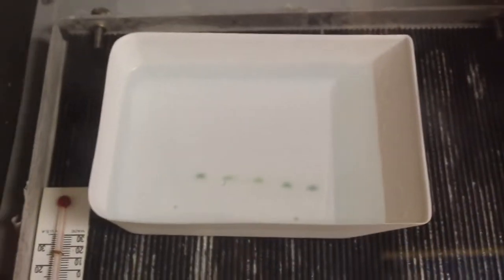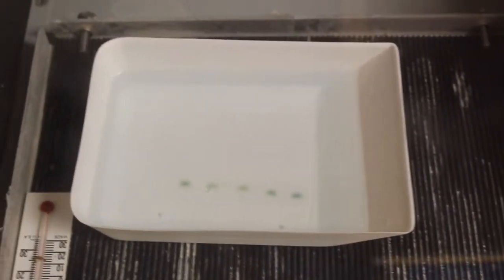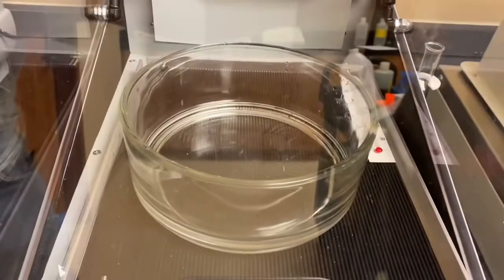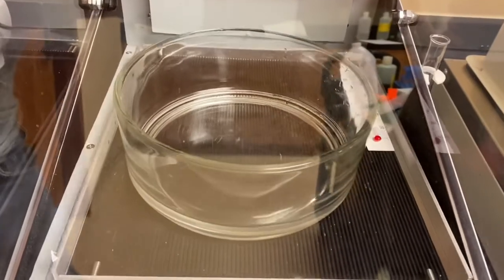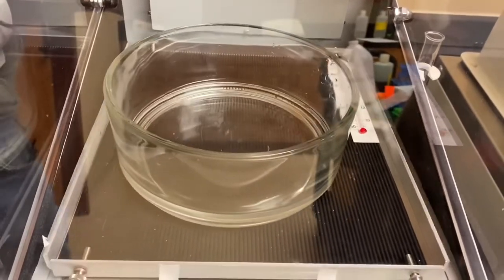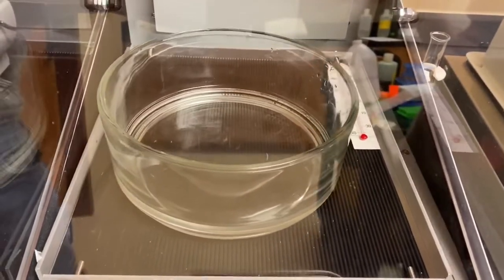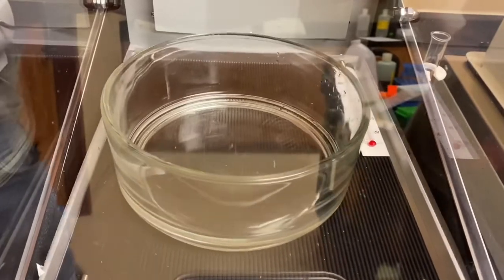This clip shows our gel and the fixative solution. Here we are gently agitating our gel in the stain solution and we will wait about 20 minutes to get some results.